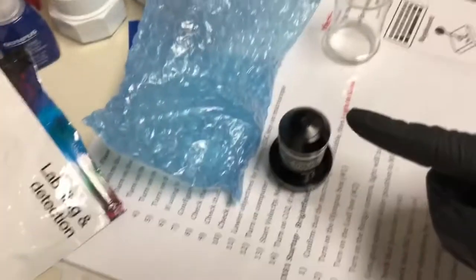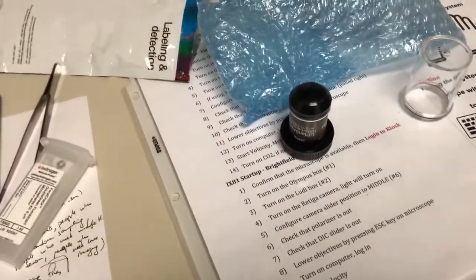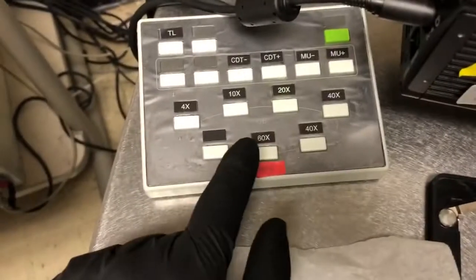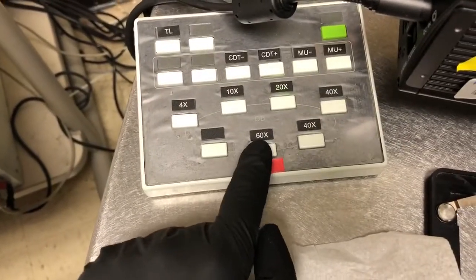Again, we have to be very careful with this objective—it's very expensive and there's no replacement. If it breaks, we're out of luck. To put this on the microscope, we're going to go to the 100x or 60x position.